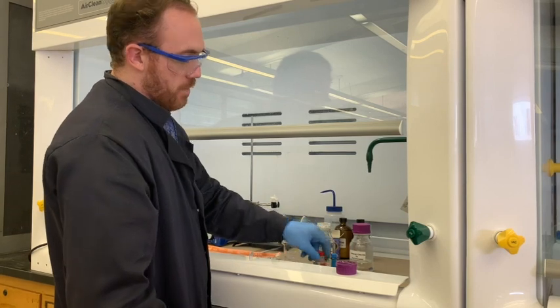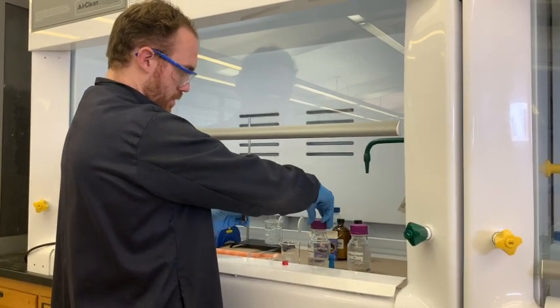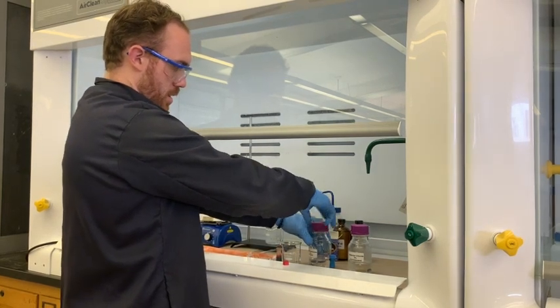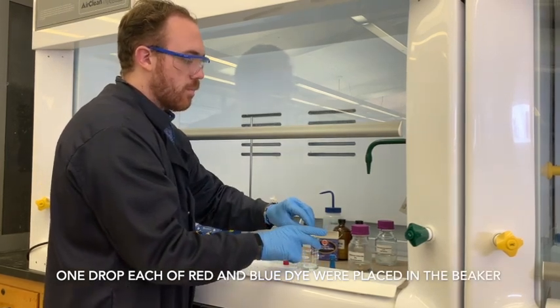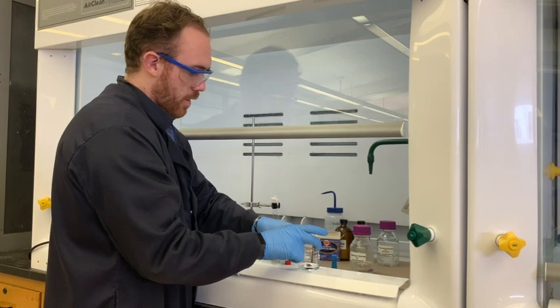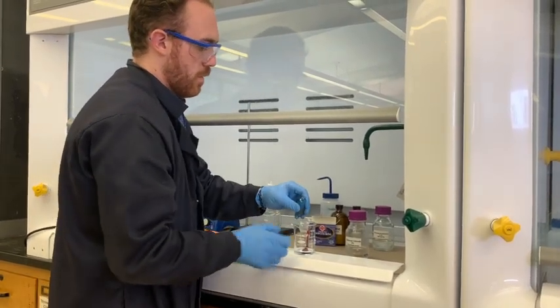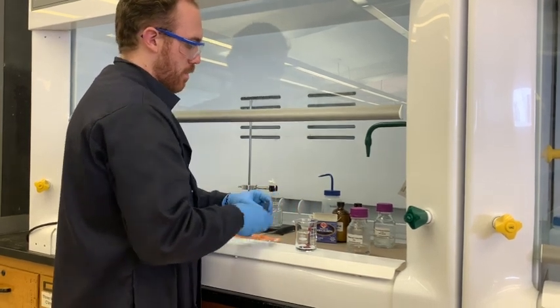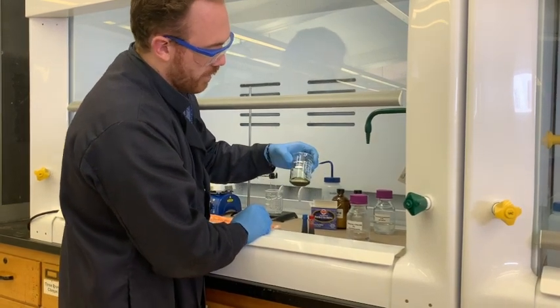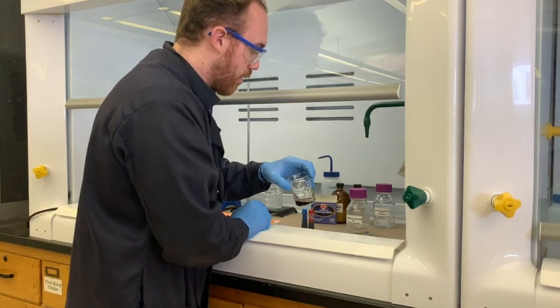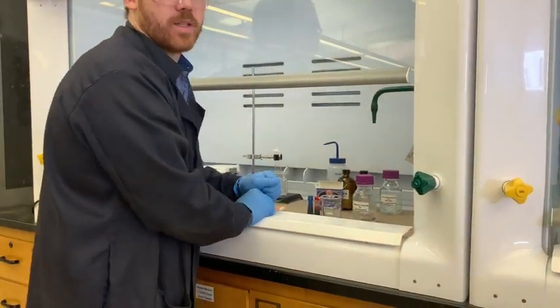And then we're going to dye it. Then, I'm just going to take one drop of each of these and put them into my aqueous solution after I close the lid, of course. Don't want to contaminate starting materials. So one drop into this solution of the red, and one drop of the blue. Alright, so we got a little bit of red and a little bit of blue there. And it turned out to be a bit more of a greenish brown color. I know it's not reacting. Alright, so now that this is mixed together, I don't know if this is going to be as pretty as I hoped it would be, we will see.